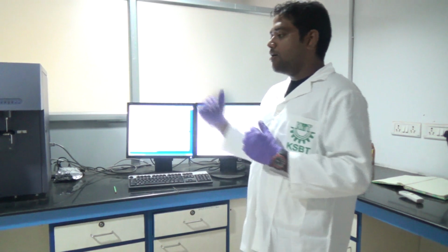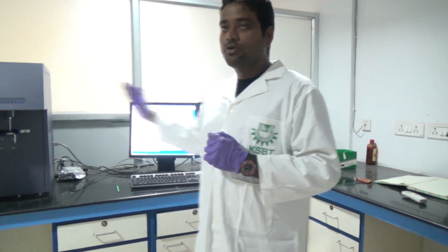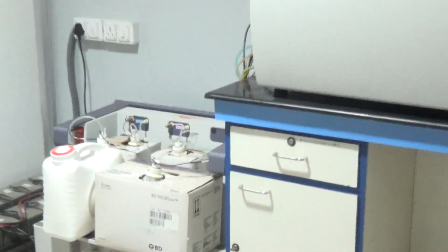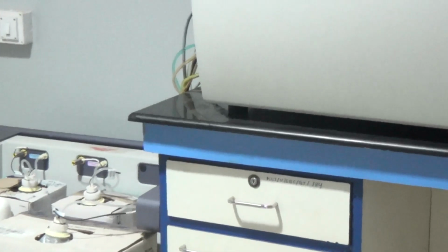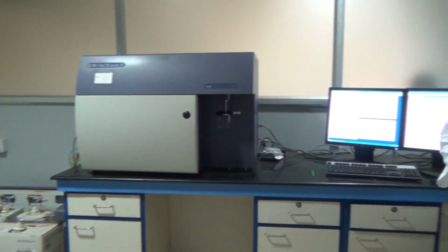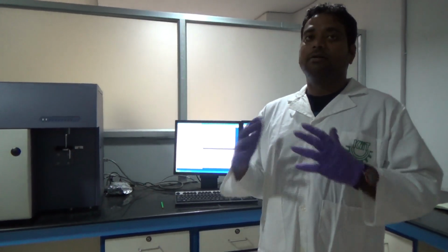So this is how the system works, from fluidics through optics to electronics. Fluidics, optics, electronics, and we are controlling this instrument using the FACSDiva software. We are analyzing so many things by applying gates. We can control the air pressure, the flow rate, the PMT voltage, the movement of cells, and we can count those cells. Many things can be done with the help of this flow cytometer.